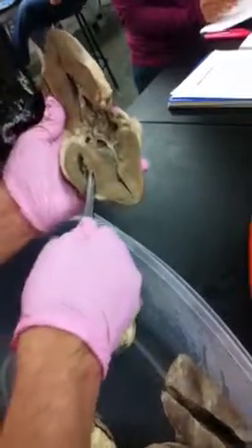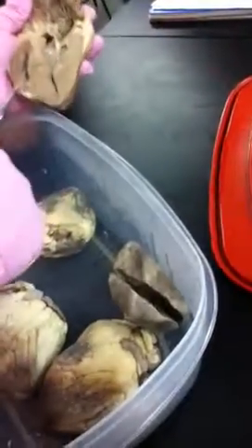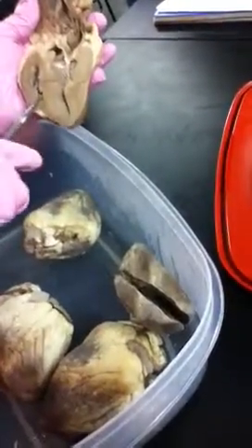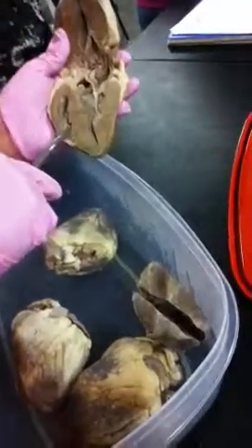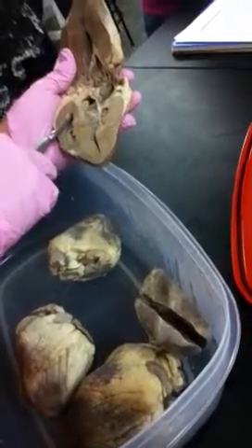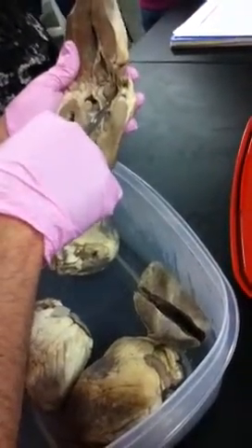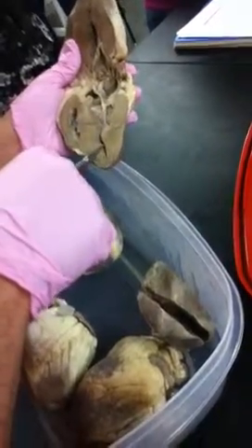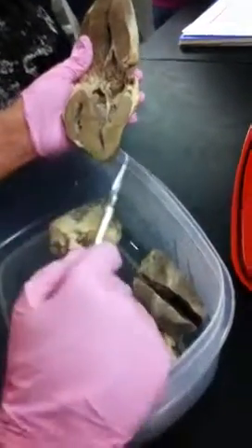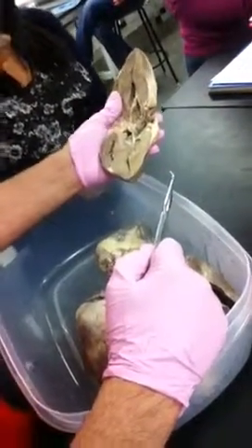If it's going into the right ventricle, pulmonary trunk. I have to clearly show you a right atrium and a right ventricle. So right ventricle: pulmonary trunk, or you could say pulmonary arteries. Right atrium: inferior or superior vena cava. Left atrium: pulmonary veins. Left ventricle: aorta. Papillary muscles.